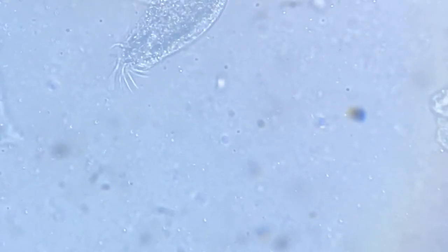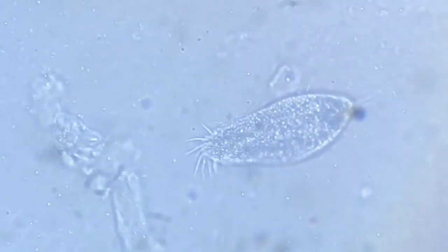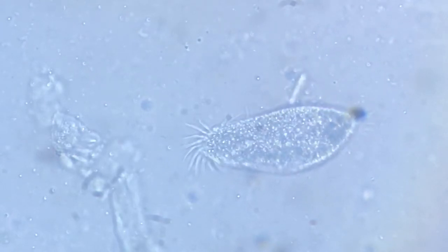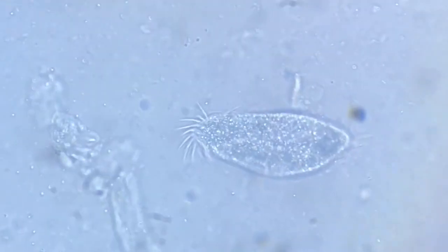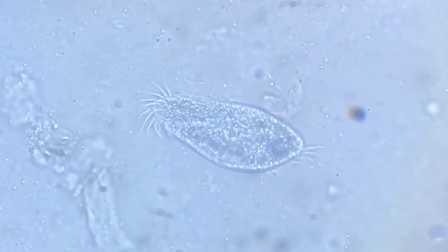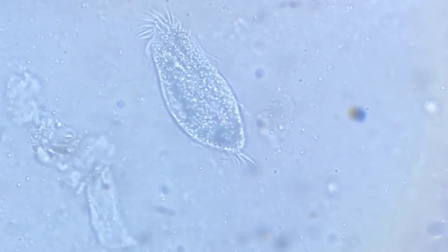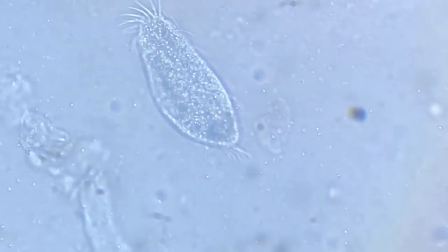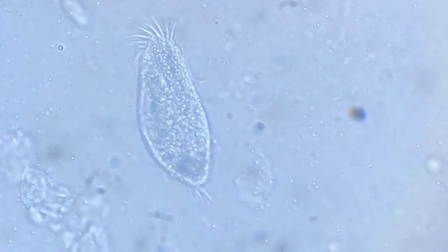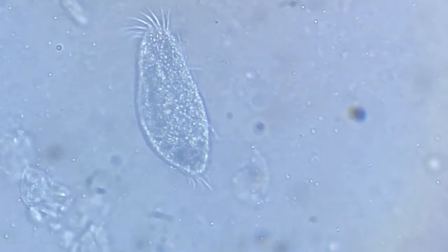This is the ciliate I am talking about. It has lost a lot of energy trying to move through this thick mucus-like substrate, and having used a lot of energy, it's going to die.